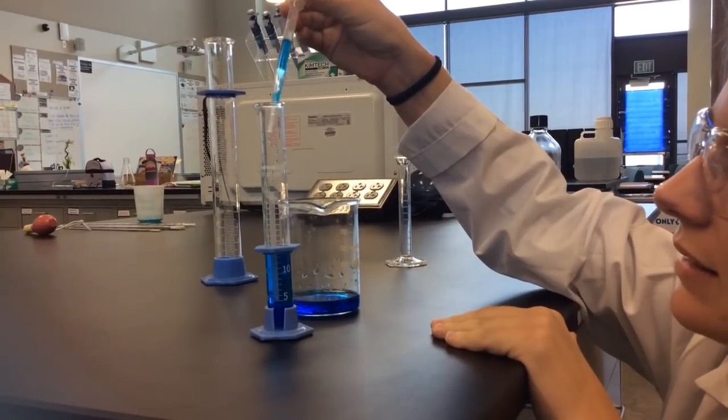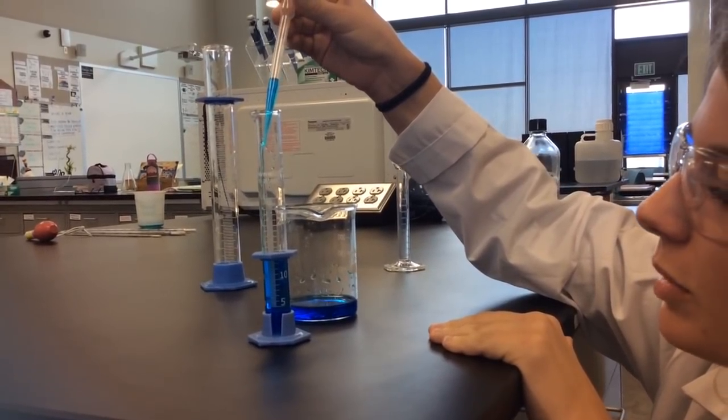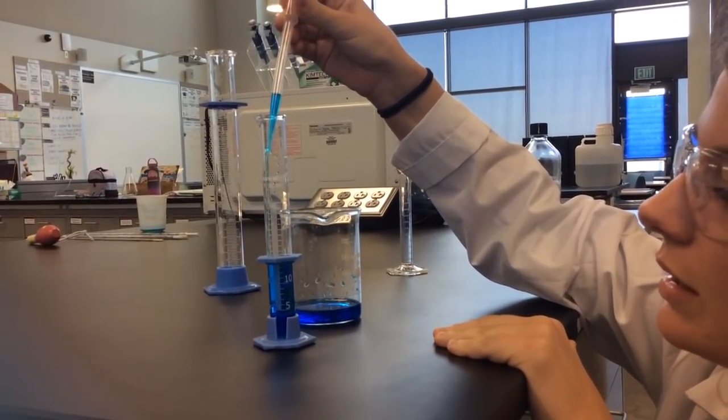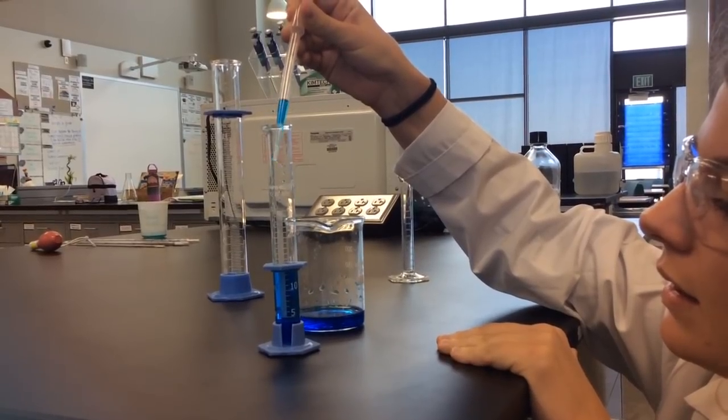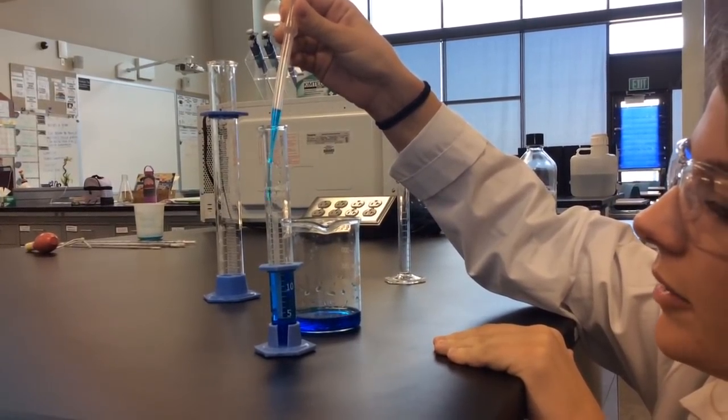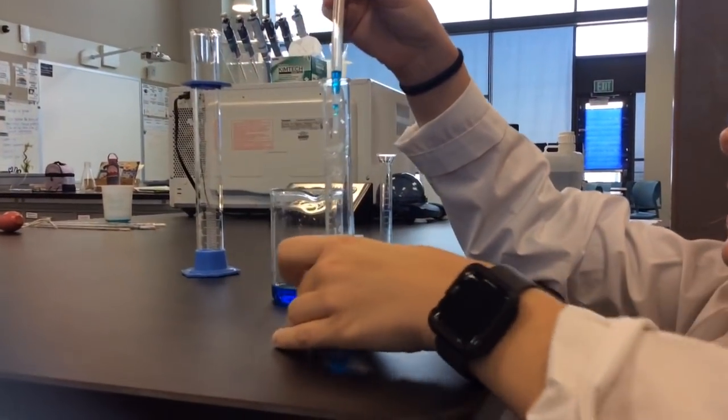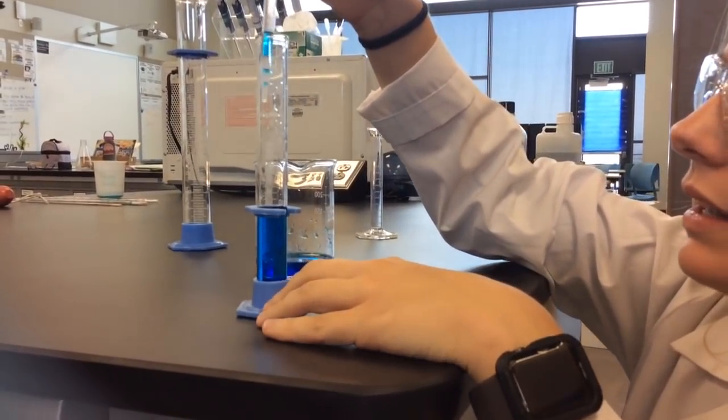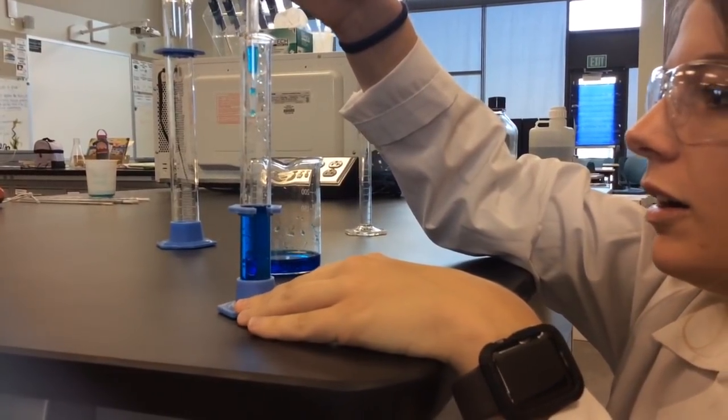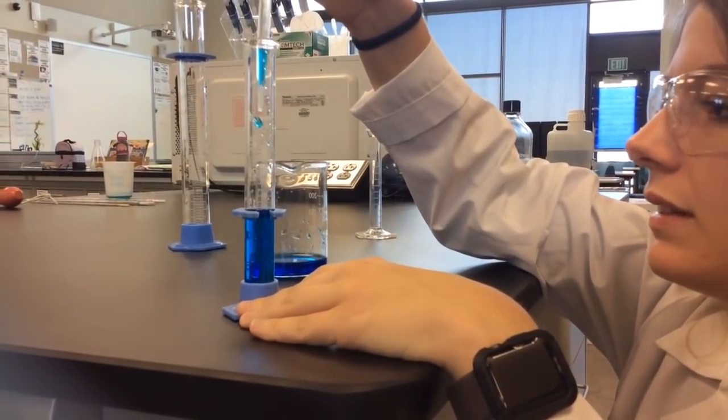And sometimes it can be a little faster if you need a little bit more, so I'm just going to do this quickly because it's not quite there yet. And now that it's getting closer to it, I'll actually turn it this way. We'll do it really slow.